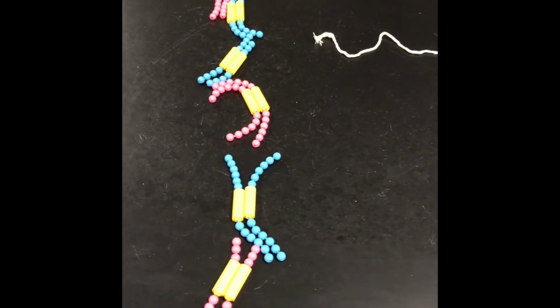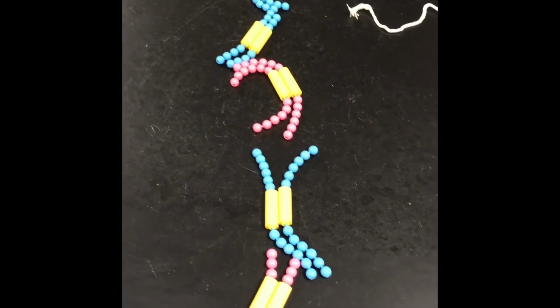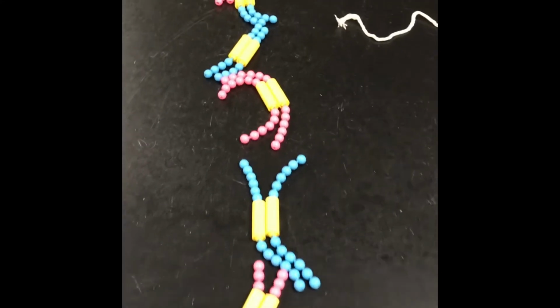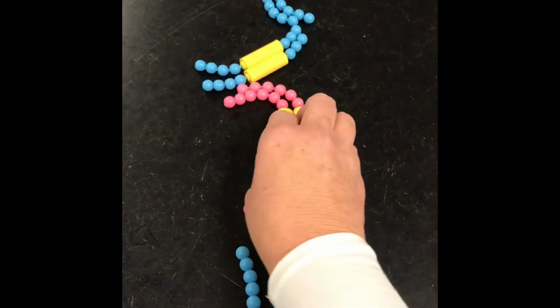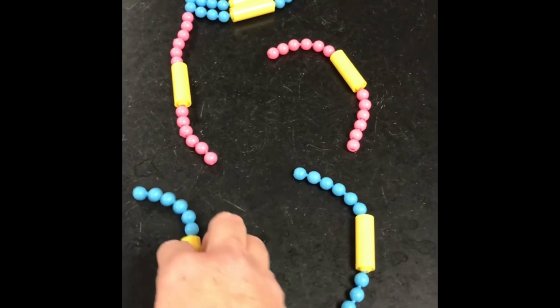So they're lined up in the middle of the cell, and there is no more nuclear envelope present, because metaphase literally just has them lined up to do a head count. Okay, from that point forward, we're clicking into anaphase. So all the kinetochore microtubules grab on and pull the sister chromatids apart. So it'll look like this.